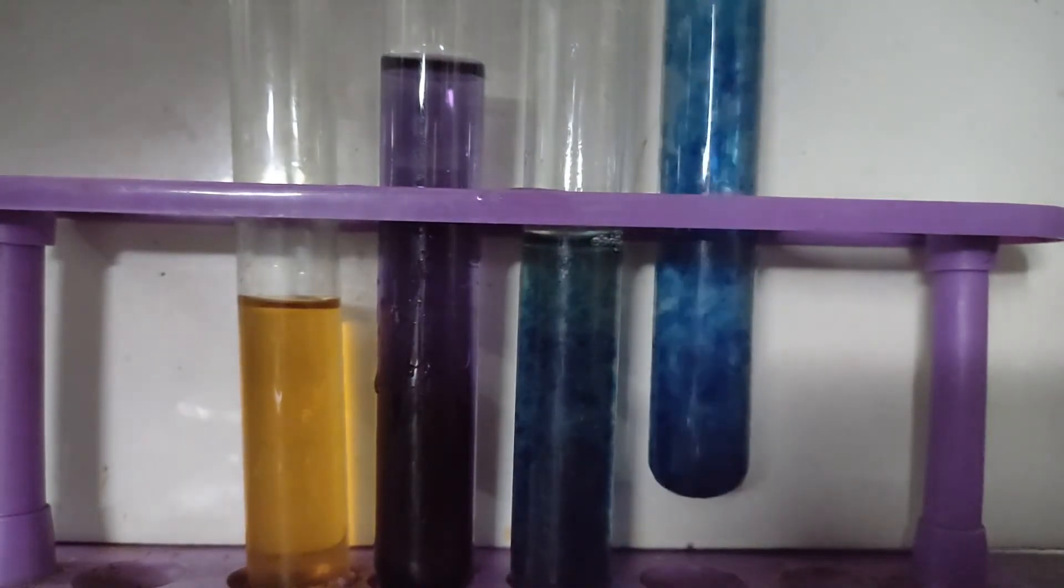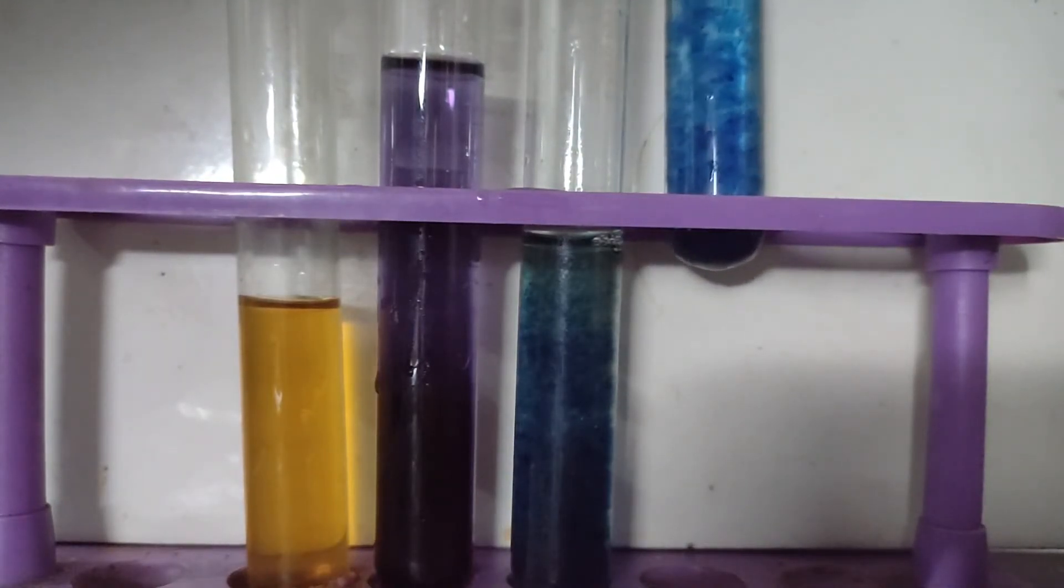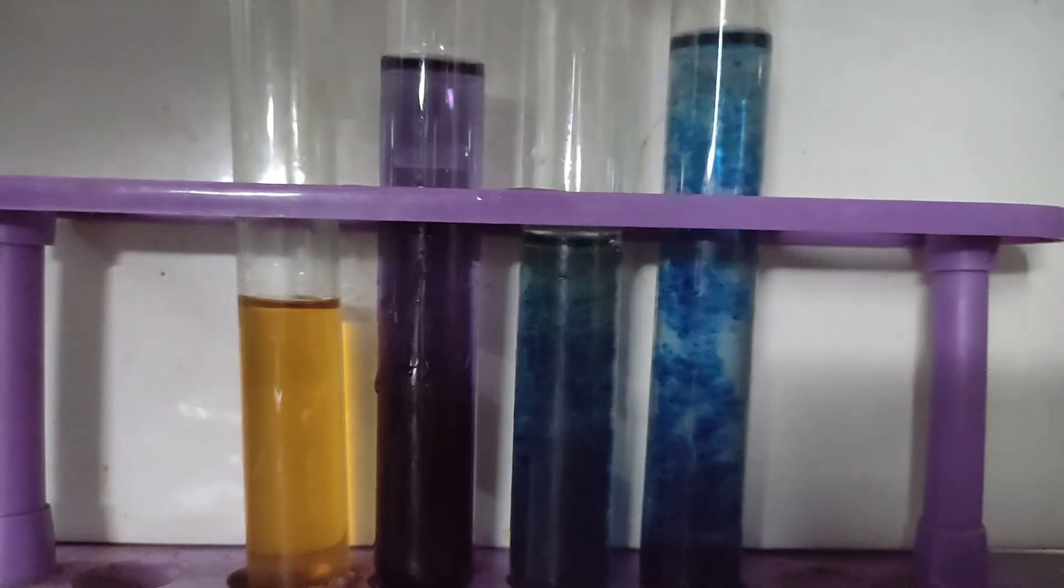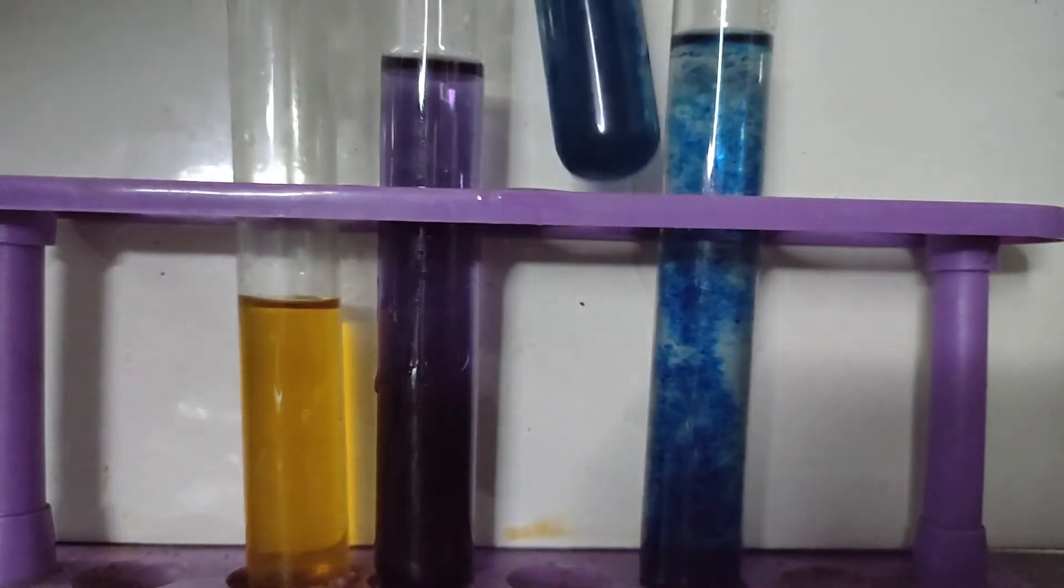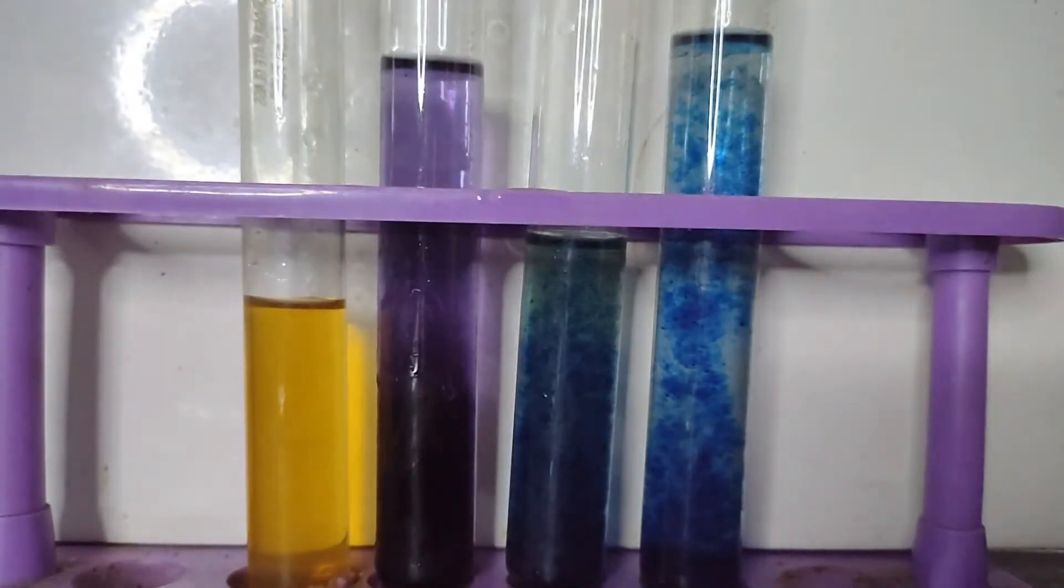After some time, the blue lakes are formed more nicely and have started to coagulate. The blue lake formed in the tap water is due to the presence of magnesium ions in tap water.